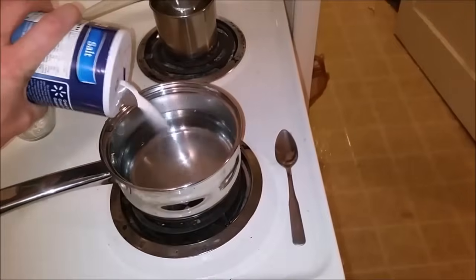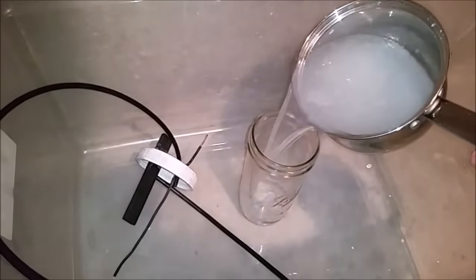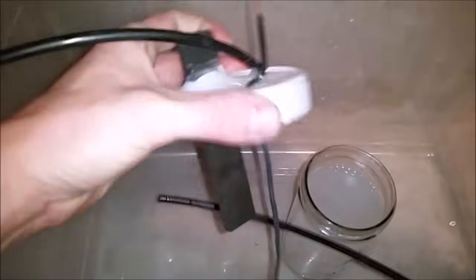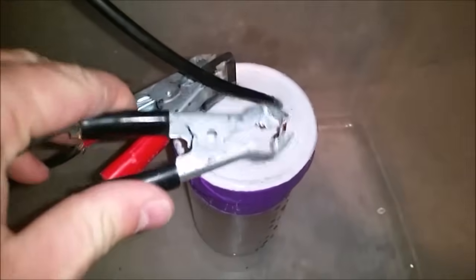First we got to dissolve it into water to make a highly concentrated solution. As you can see I'm doing that here. Once I have the concentrated solution of sodium chloride I'm going to add that to a jar with about a pound of mercury. What I have made here is a chloroalkali mercury cell. I've got a copper wire which goes all the way down and a carbon rod which goes into the solution. Hook up the positive to the carbon rod and the negative to the copper wire which is going into the mercury.